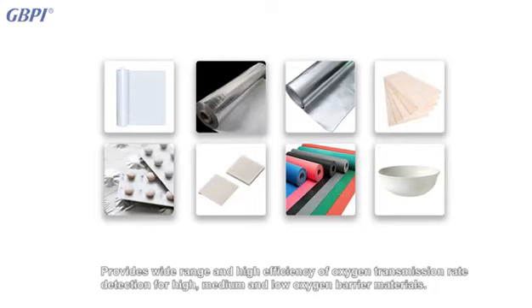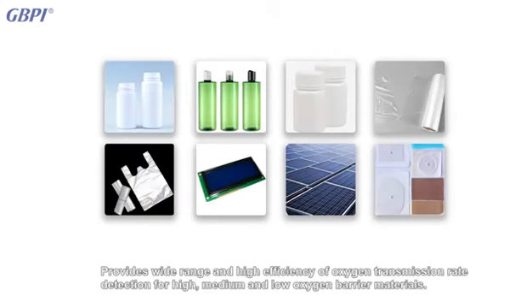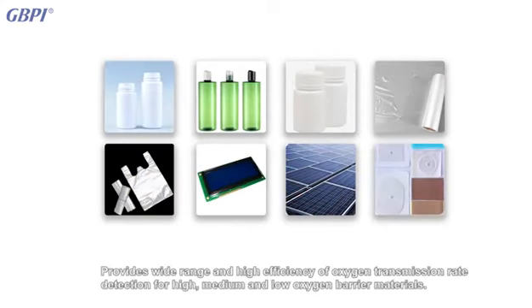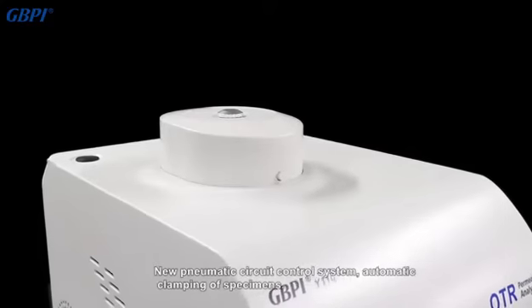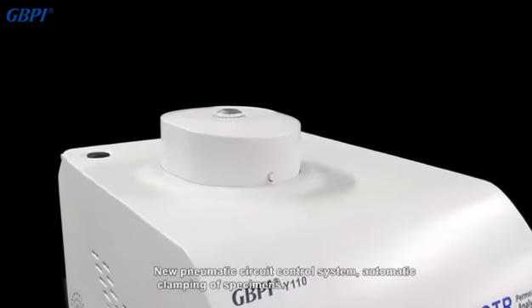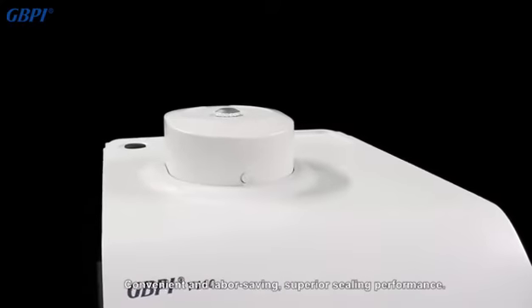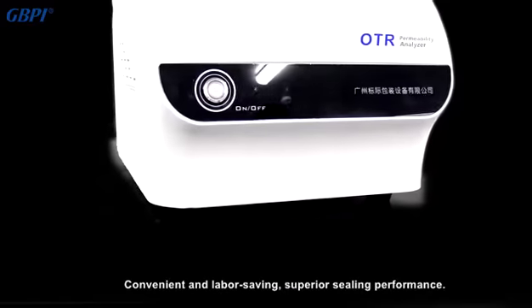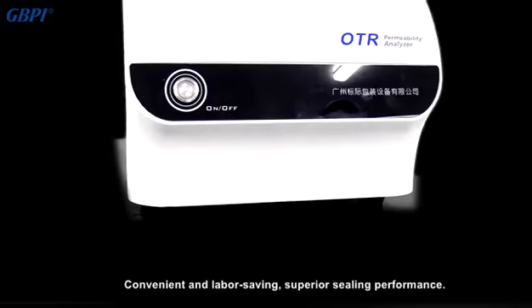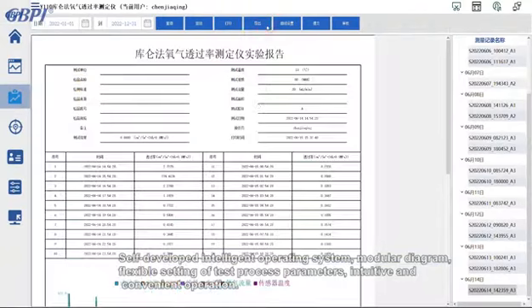It provides wide-range and high-efficiency oxygen transmission rate detection for high, medium, and low oxygen barrier materials. The new pneumatic circuit control system enables automatic clamping of specimens — convenient, labor-saving, and with superior sealing performance — alongside a self-developed intelligent operating system with modular diagrams.